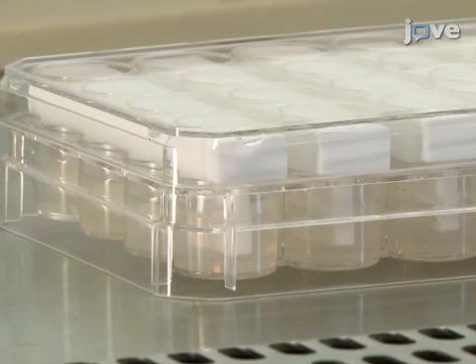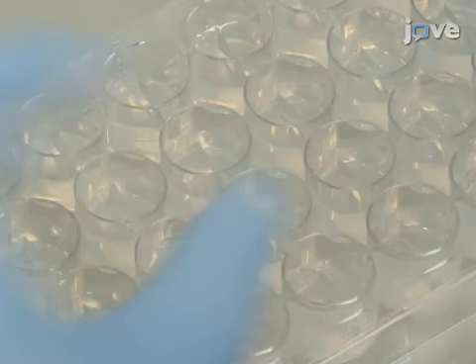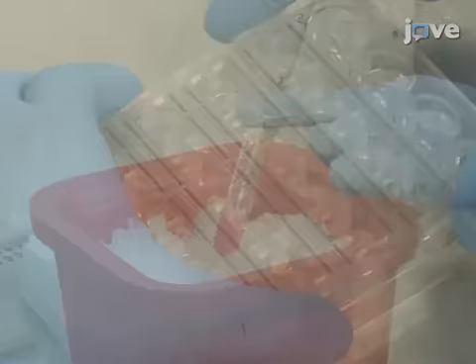After about 10 minutes at room temperature, the agarose will become opaque, signifying its solidification. Remove the spacers and place PDMS racks into the castings so that pairs of rack posts reach into each agarose mold.